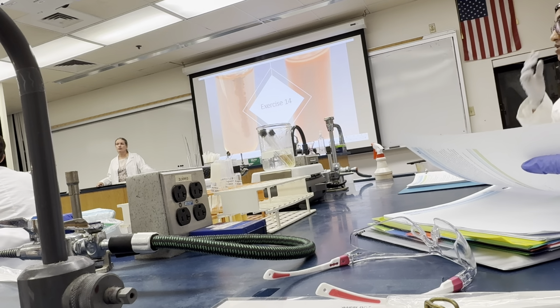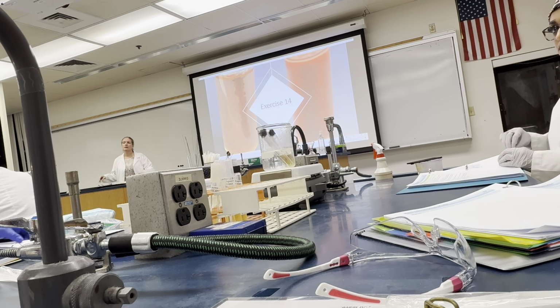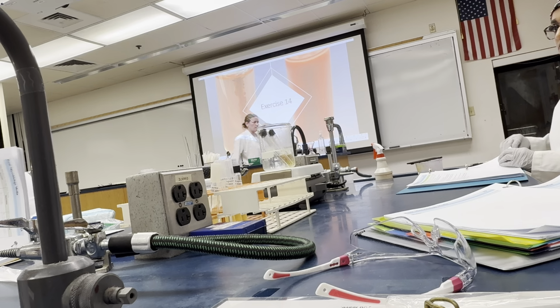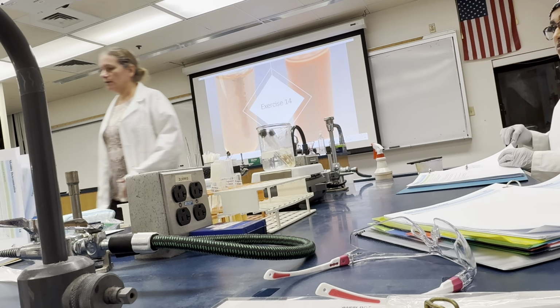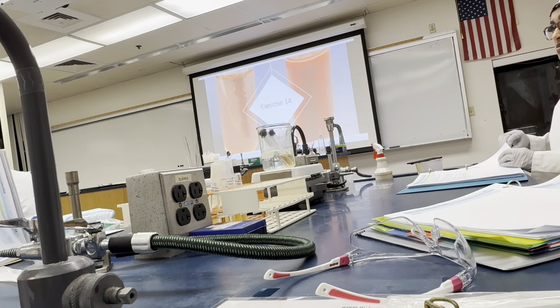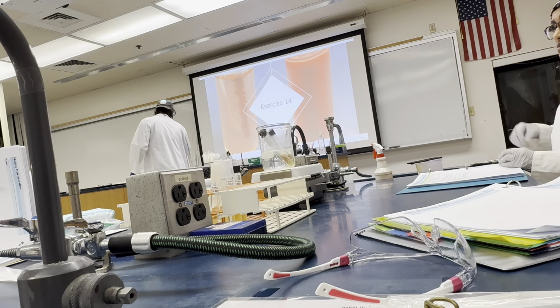Okay, one of our tubes broke. Okay, just grab another one. So this older thing's going to be covered. Grab another one there.